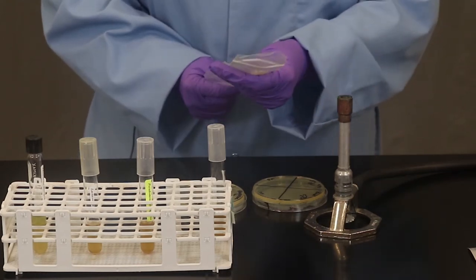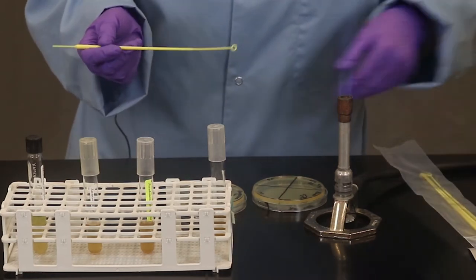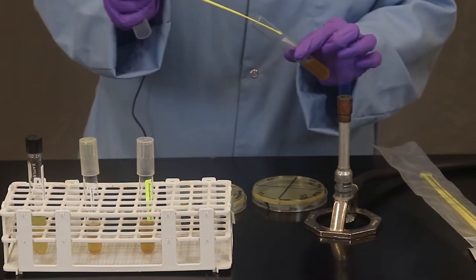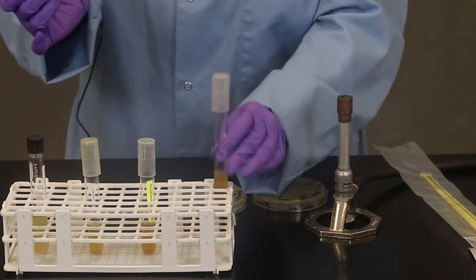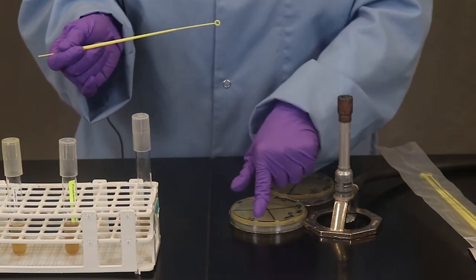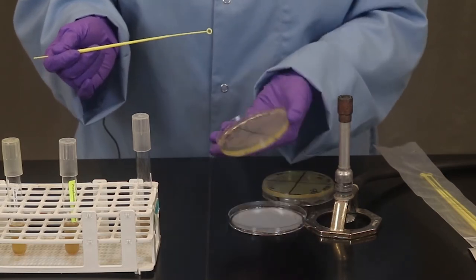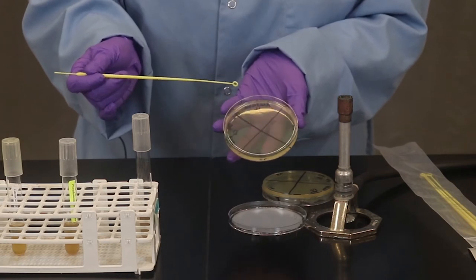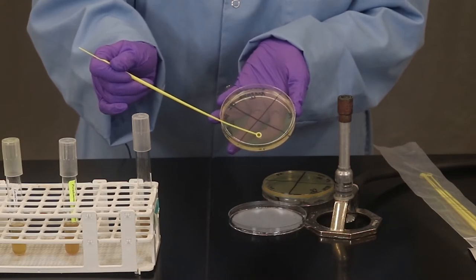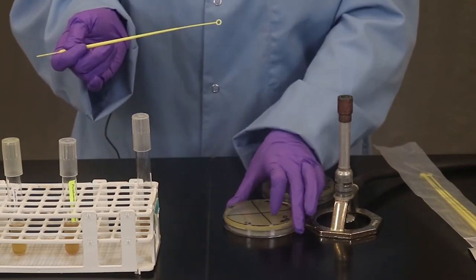To aseptically remove my loop I'm going to peel out one, grab it by the edge, the tip pull out. I'm going to dip into the bacteria once. And we're going to perform what's called a spot inoculation. So I like to put my finger on the quadrant that I want to lay the bacteria down on, in this case the one labeled SL for Serratia liquefaciens. Pick up the plate. My finger is now in the position I want to inoculate. And to spot inoculate you're going to touch the loop down and you're going to rub in a circular like motion.